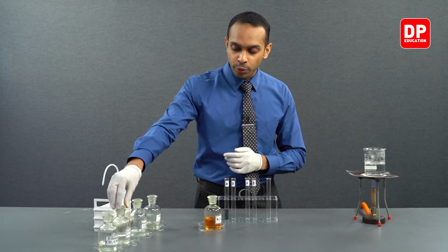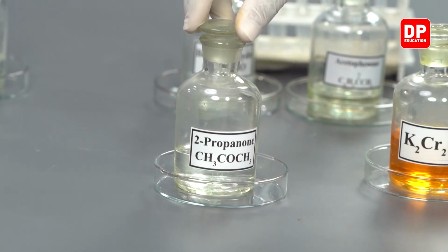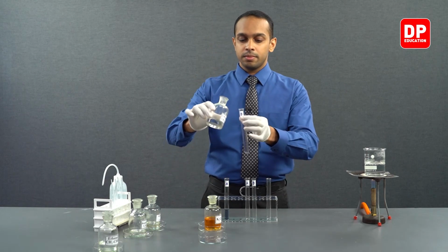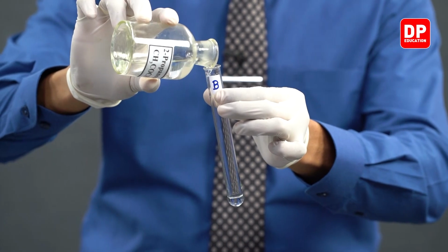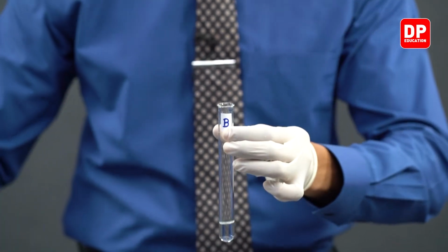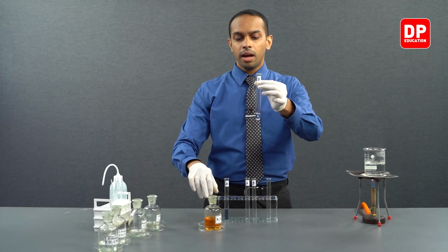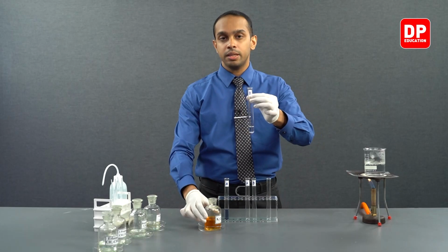Let's move into our aliphatic ketone. We have 2-propanone, or in other words, we have acetone here. Let's take a small amount of acetone into our test tube labeled B. And to this acetone, we will add acidified potassium dichromate.